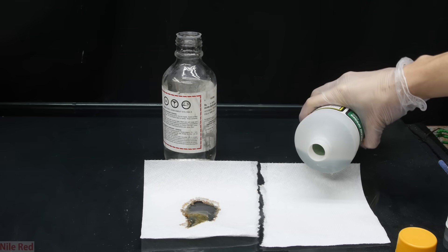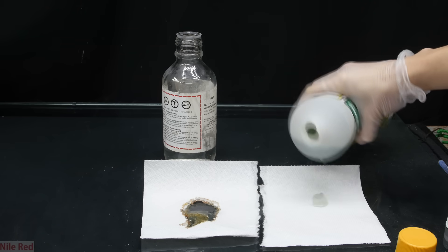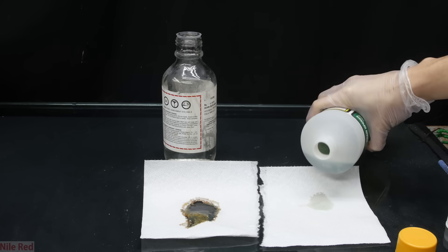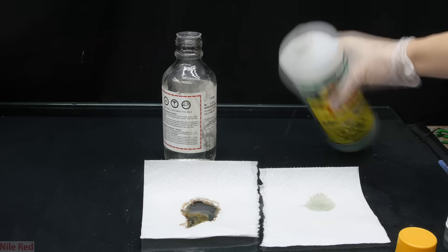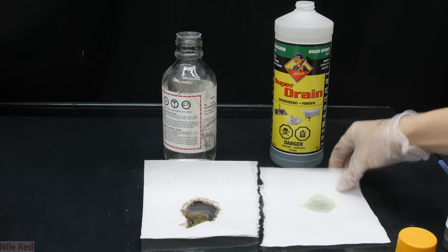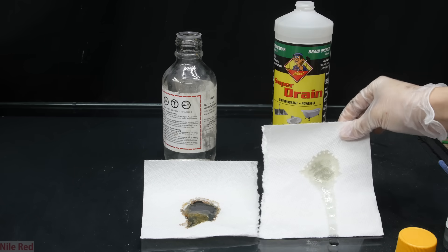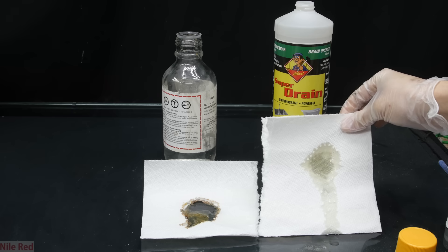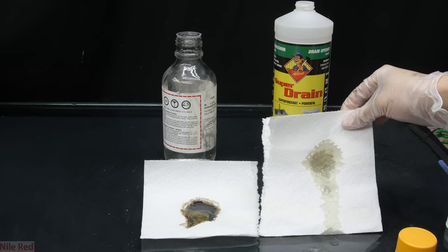Sulfuric acid is used as a drain cleaner because it's pretty good at breaking down organic material like hair and other things that might get caught in a drain. The sulfuric acid-based drain cleaners can be sometimes hard to find, but I actually managed to find it at quite a few stores.